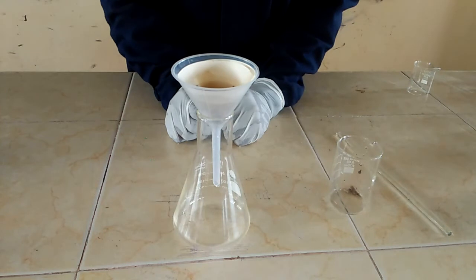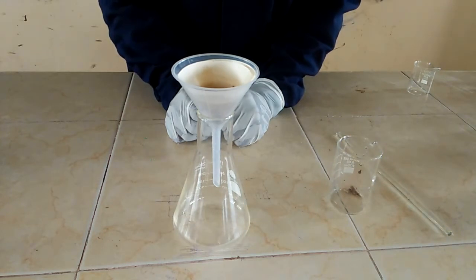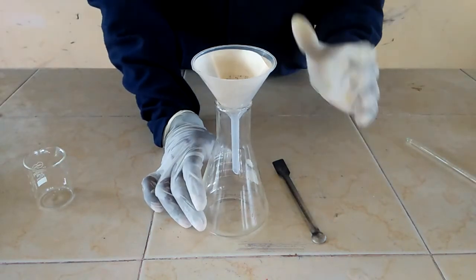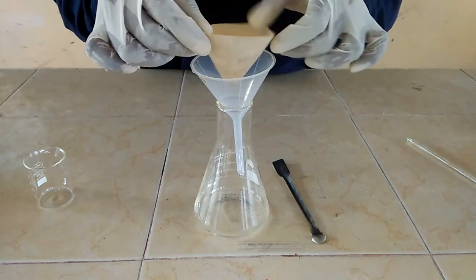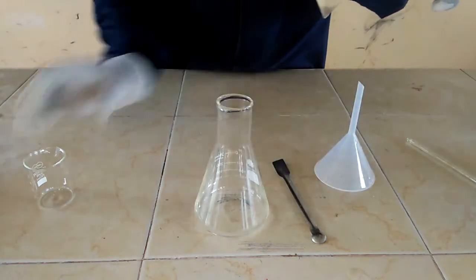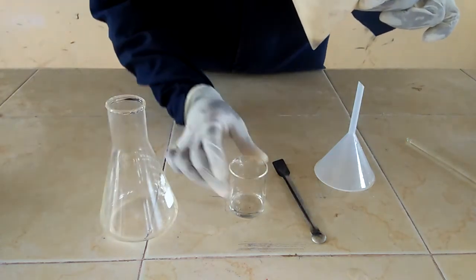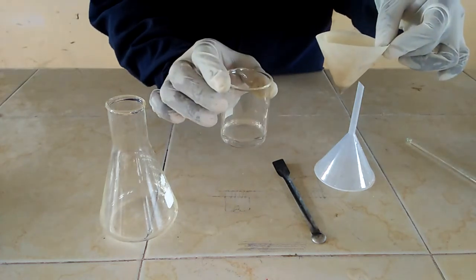Give it some time so that you allow it to filter. After some time we have already filtered our mixture. Let us see what has developed. So we have our water which we have filtered — this is our filtrate. You can see it is very clean.